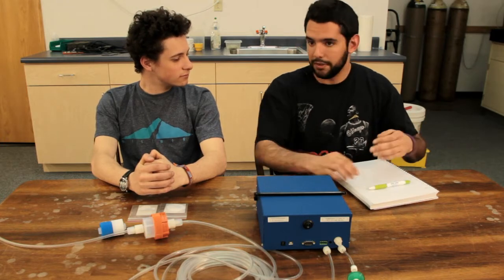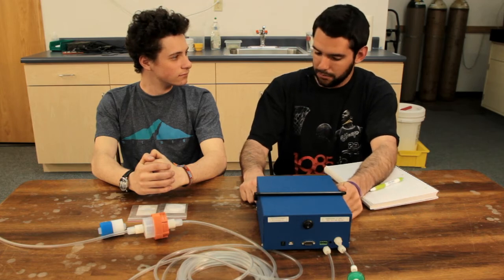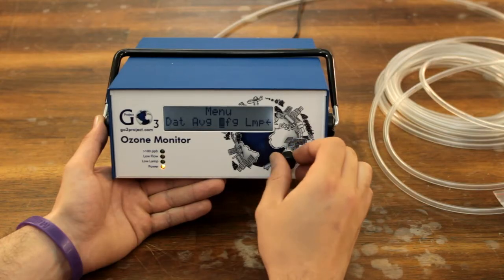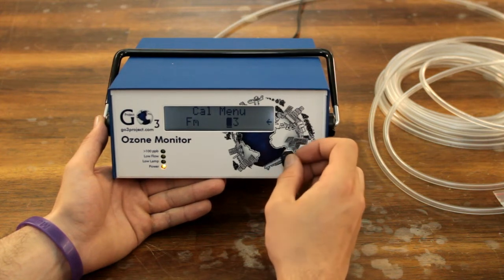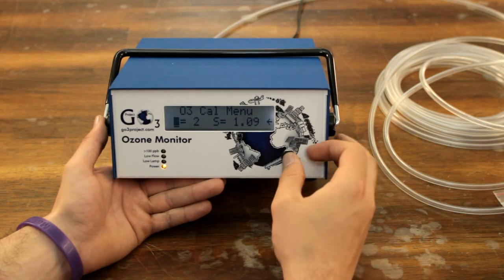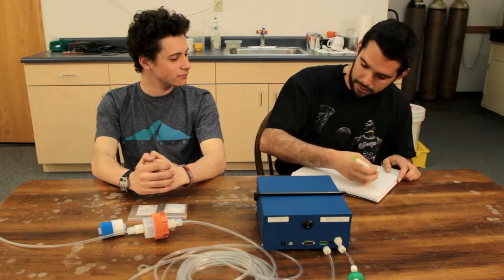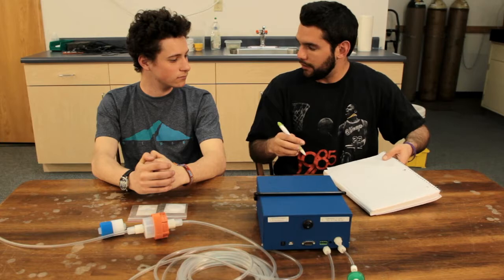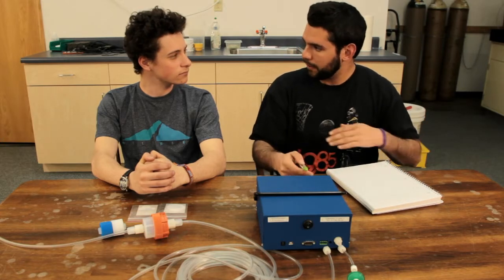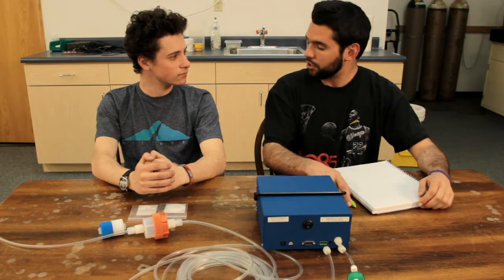The way that we're going to account for this is we're going to go back into that same menu where we changed the Z. So Menu, CFG, Cal, and change that Z to 2, the direct opposite of what we got, -2. Once we've done that, we'll go back into the same display screen again, take another 20 measurements to see what kind of average we get. Once we've got that average, if it's anywhere in between -1 and 1, we've accounted for our offset and we've changed our Z, and everything should be correct.